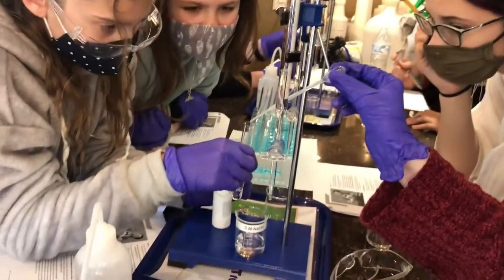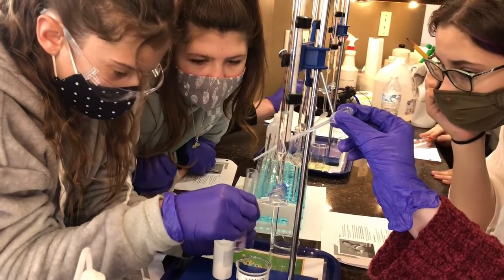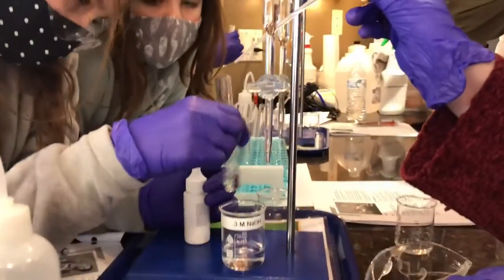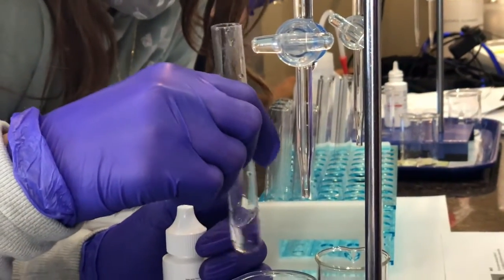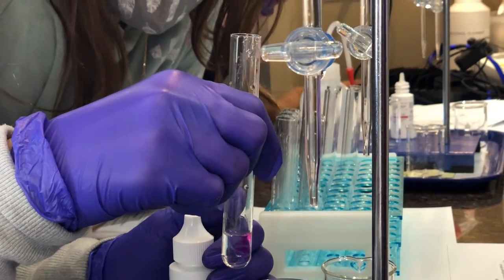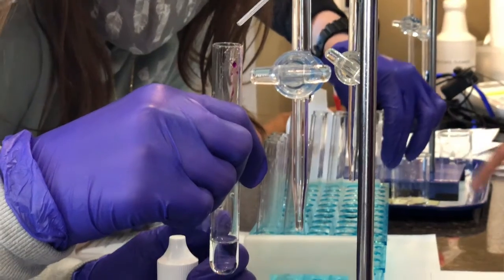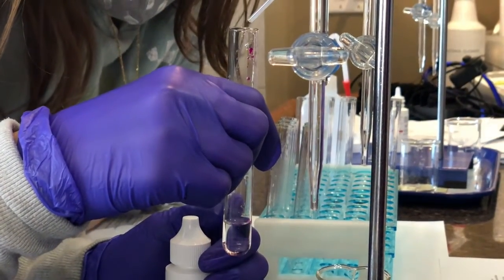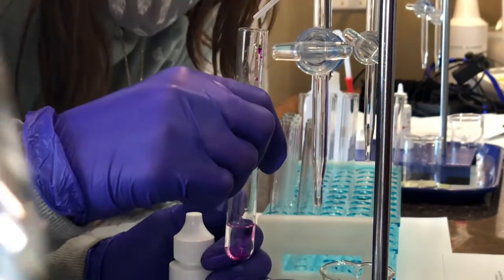Science. Hold off until we learn. You guys ready? Go on to the next one. Oh, under that. Okay, how many? They're still dangerous. Okay. Is there liquid in here? Yes, they are. Go grab that. This line right here. Yeah. Where do I put this? Right here. 13, yeah. How dangerous are the chemicals after doing it? Not really, but still, you don't want to mess with it. Sodium hydroxide. But you need to set a precedent. Sodium hydroxide? Yeah.